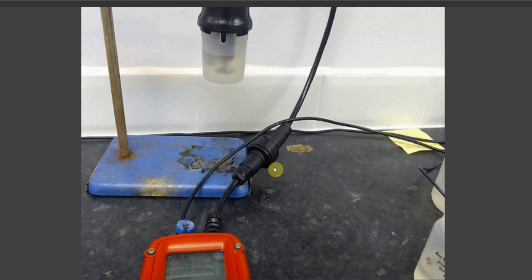It should be noted that the plating process is one of the more delicate operations of the Metalyser unit and can be prone to failure for a number of reasons. Incorrect polishing is one, the other is the co-deposition of mercury, and another is physical damage to the electrode, along with a number of other reasons. To check that this has not occurred, please view the plate verification video, which will cover how to ensure that the plate that you have is correct and suitable for use.